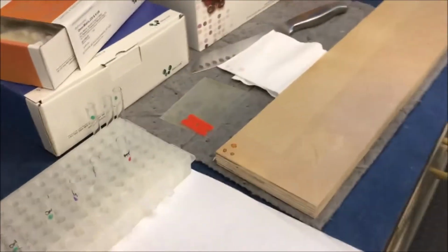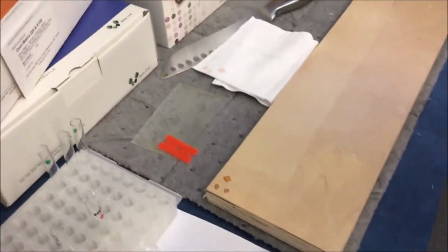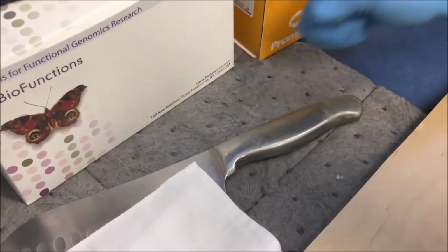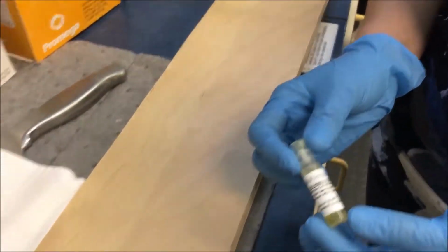Now we'll show you trace DNA collection, where the DNA or biological sample is not visible. For instance, if we suspect there must be a DNA sample on the handle area of the knife, we will take the spray and spray it on that suspected area. Similarly, on the wood or any other surface where we suspect there is a biological sample, we spray on those areas.